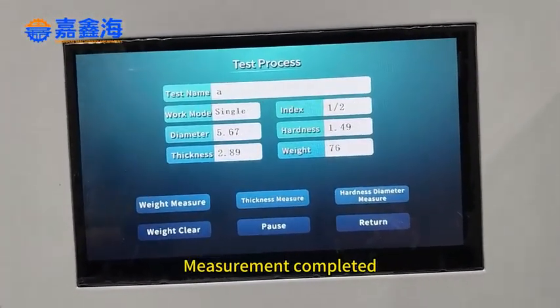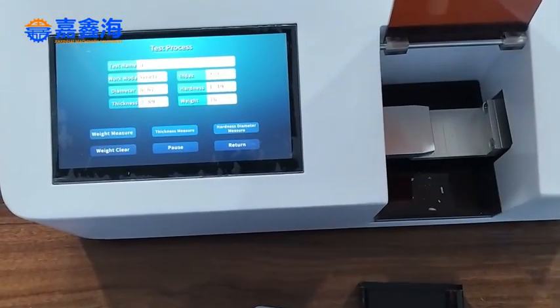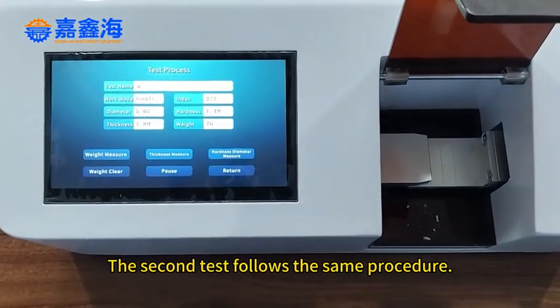Measurement completed. Take the brush and simply sweep it into the waste box. The second test follows the same procedure.